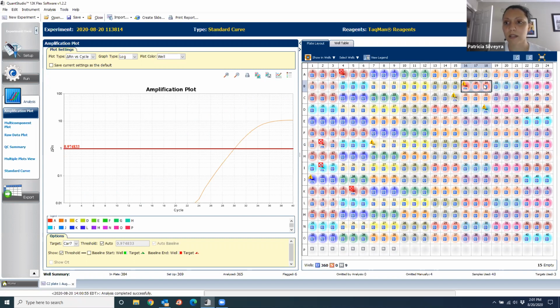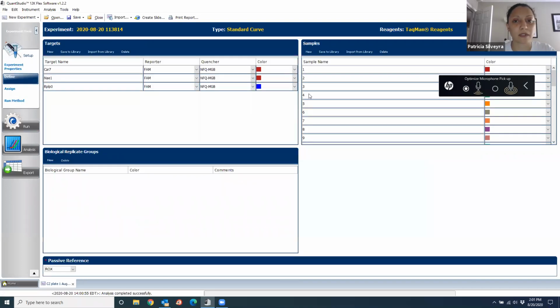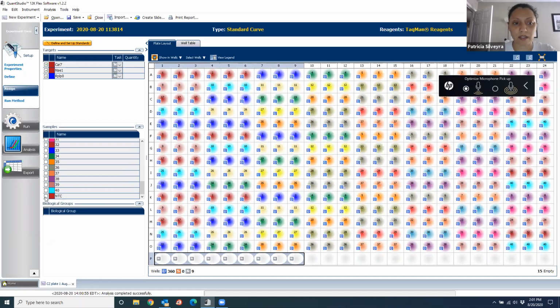There's one thing that you didn't do, and because I didn't tell you, but the non-template control, we have to, let me just go here. We have to name the sample. So if I go here to define, I'm just going to name one sample, the non-template control, and then I'm going to assign it here to your controls. And that is so that we can visualize it. It really doesn't change the experiment if you do it or not. It's just easier when we export the stuff.